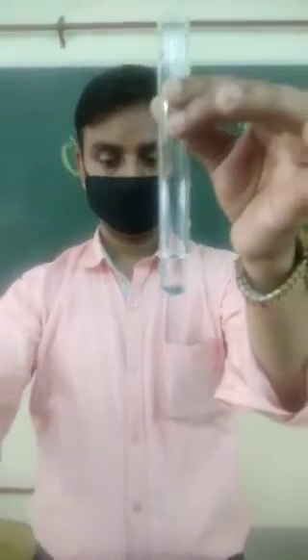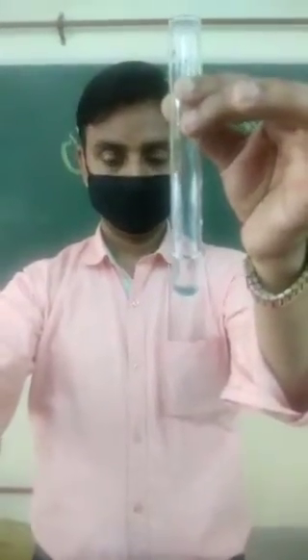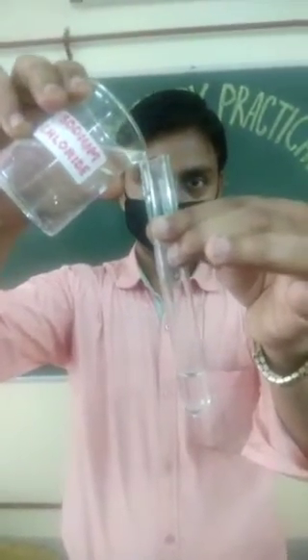This is silver nitrate — a solution of silver nitrate. And now we are taking sodium chloride solution and mixing it in.